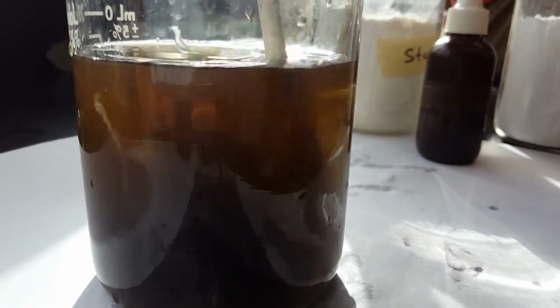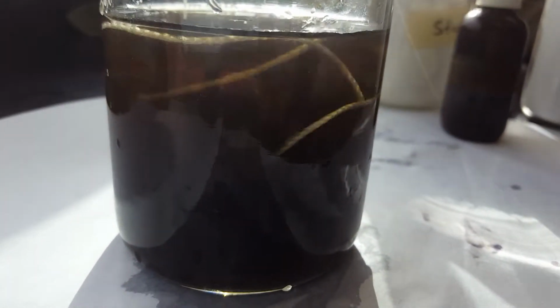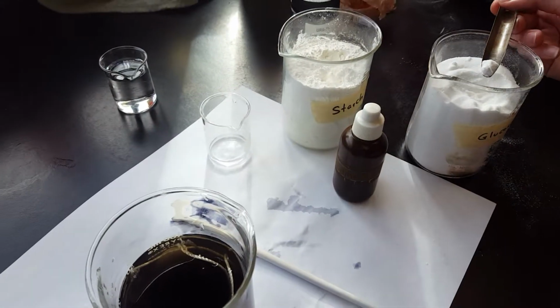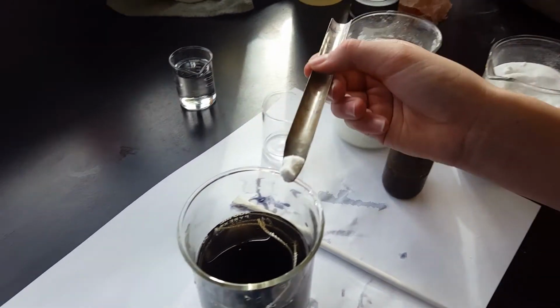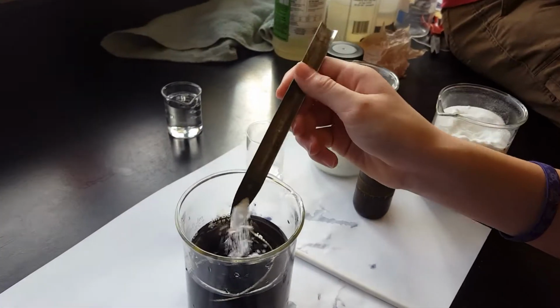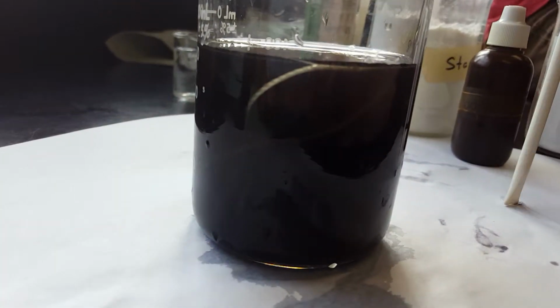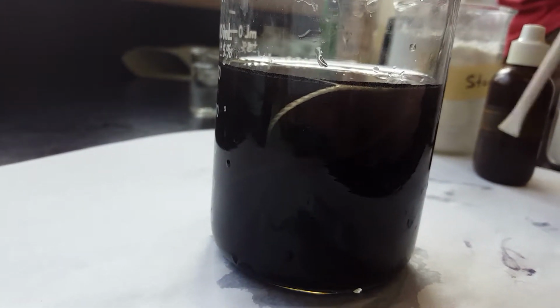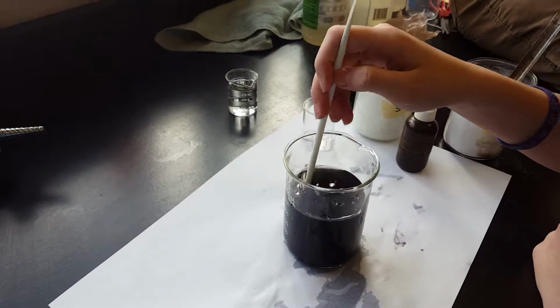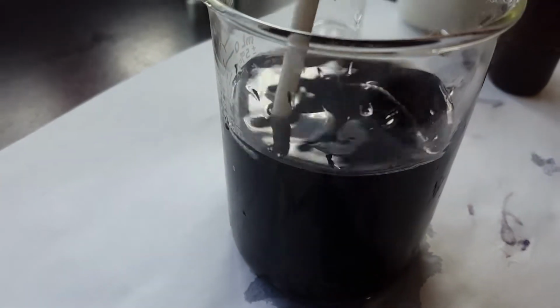So student assistant number one is now going to add some glucose to the solution. You can add about two scoops like that. One and two. And do you guys notice any immediate change when we add these? No, it doesn't seem to do anything. Go ahead and stir it up. Again, glucose and iodine doesn't look like it's doing anything.